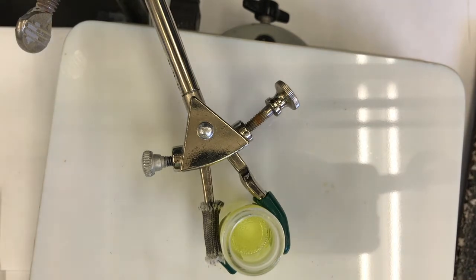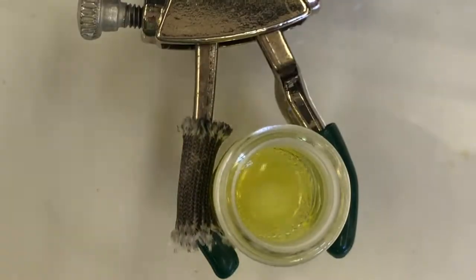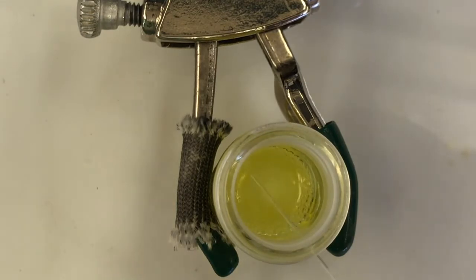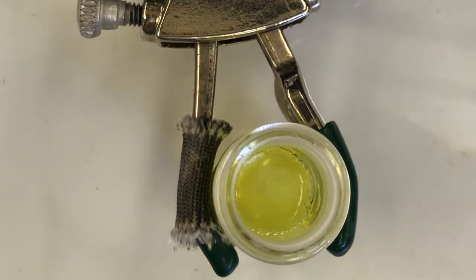Now I have to get my capillary tube, and oh, you can see it's bubbling a little bit, huh? Go. And now I'm going to stick my capillary tube in here. I've got this solution, and oh, I'm already past my time. That's okay. I'm going to go off the time that I have. So I'm going to spot, drain most of it out, and then spot it on, oh, I didn't do 0 seconds.